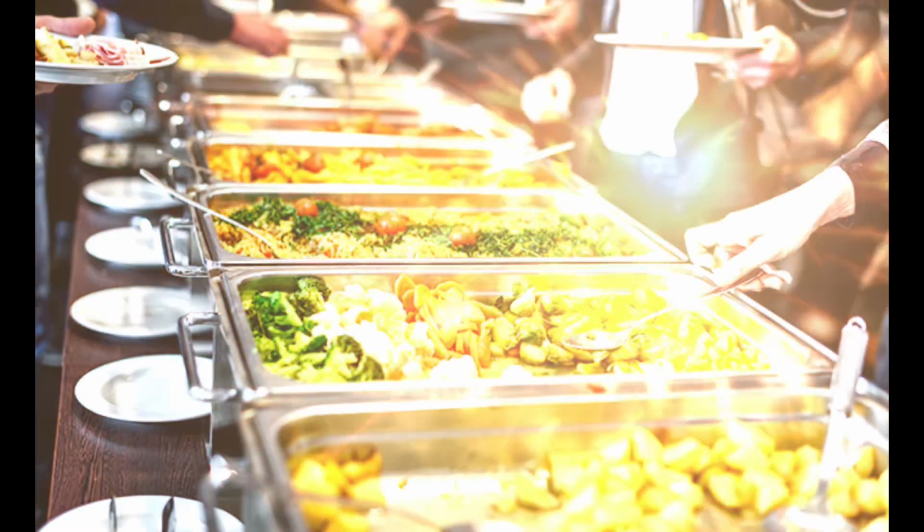Scientists use a variety of different mediums to grow bacteria. Think of each medium as a different tool in a toolbox. The first type of agar you can use is nutrient agar. It is great for growing a wide variety of bacteria. It's kind of like an all-you-can-eat buffet.